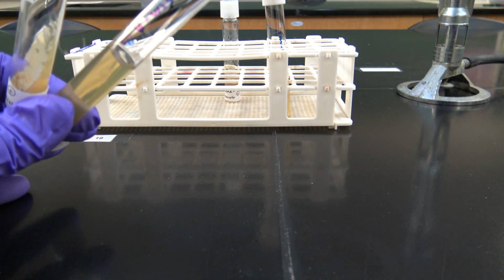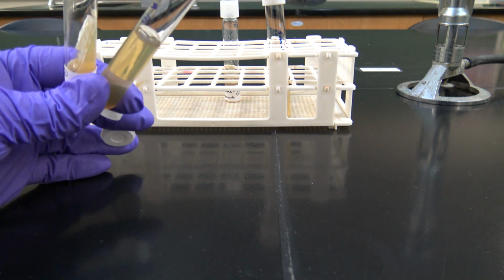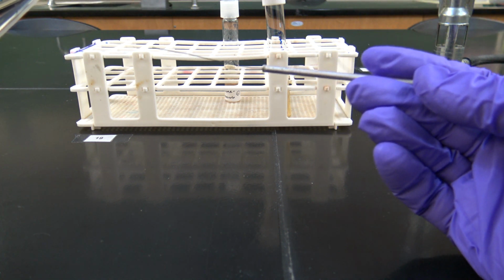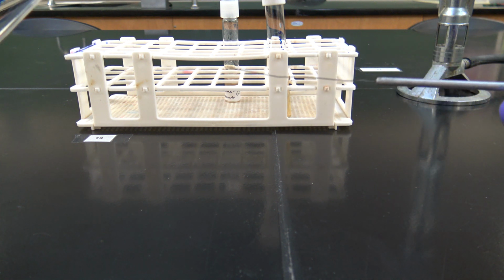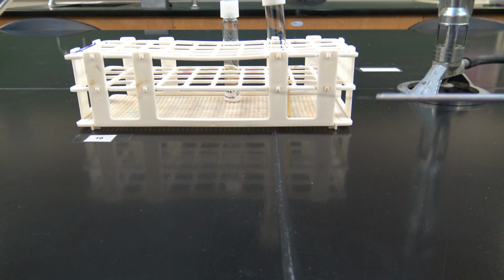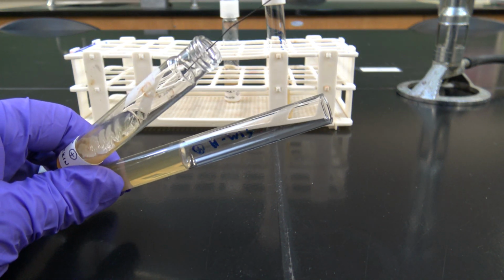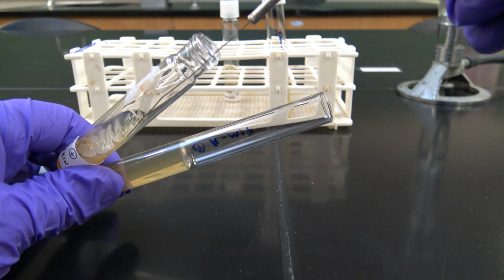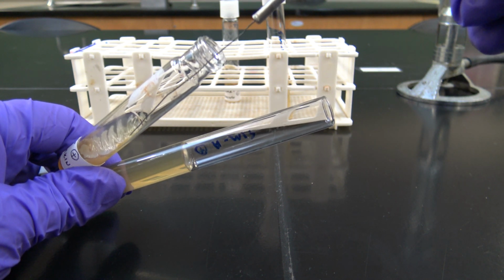Okay, so now I have both of my tubes and the caps to those tubes all in my left hand, and I'm holding the inoculating straight loop in my right. I've been sure not to touch any surfaces with this loop, so I know it's still sterile. So now I can go into my slant and just touch some of the cells here. Remember, you don't need a lot. Just going to lightly brush it across the surface of some cells that I can see there.